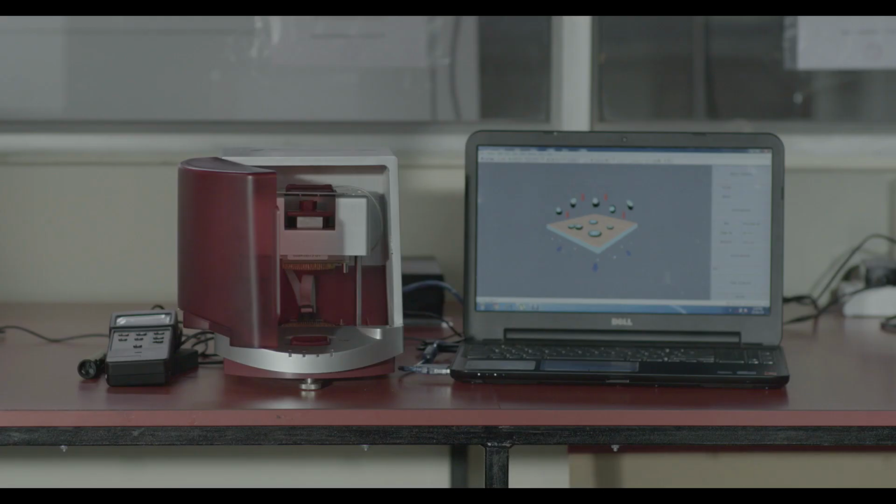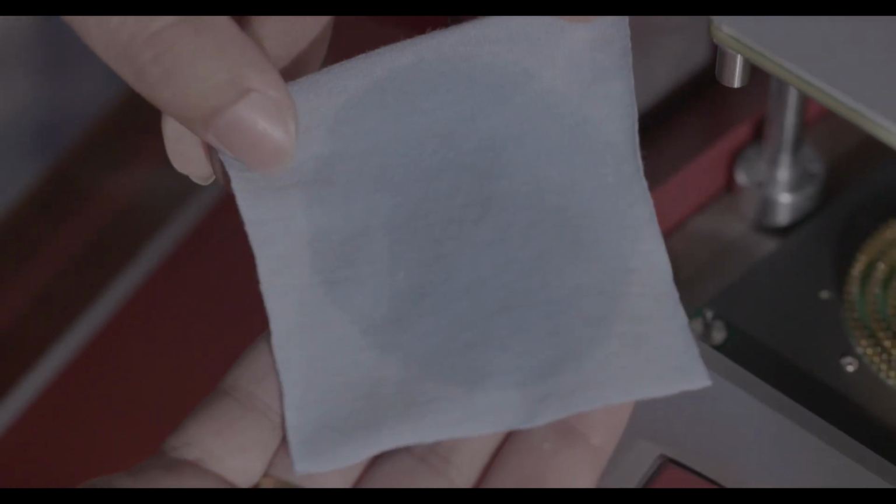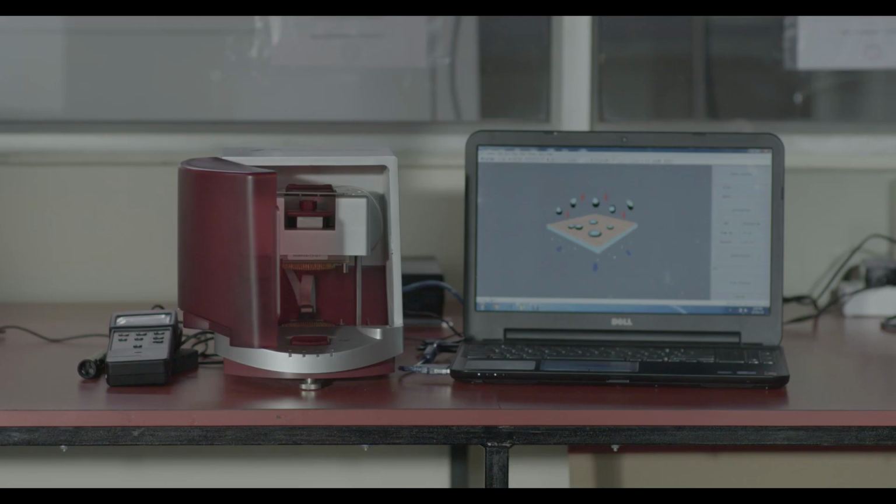During the test, changes in the electrical resistance of the specimen due to spreading of the liquid are measured and recorded. The electrical resistance readings are used to calculate the fabric liquid moisture content changes that quantify dynamic liquid moisture transport behaviors in multiple directions of the specimen.